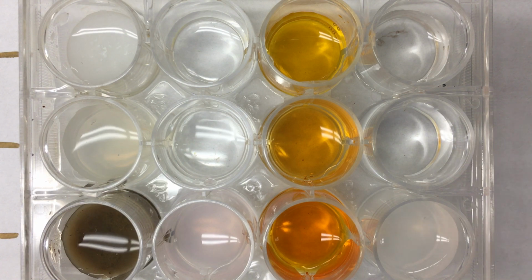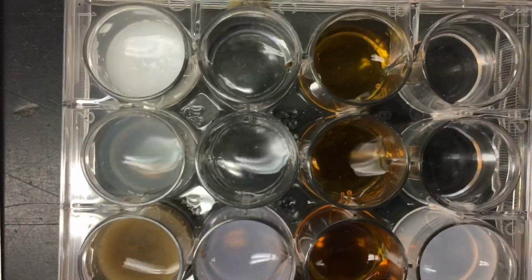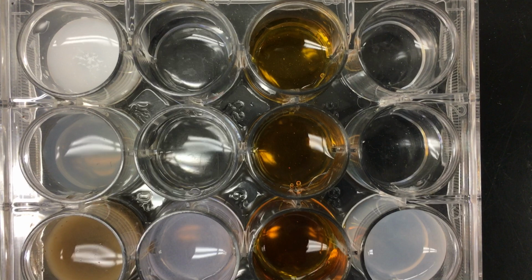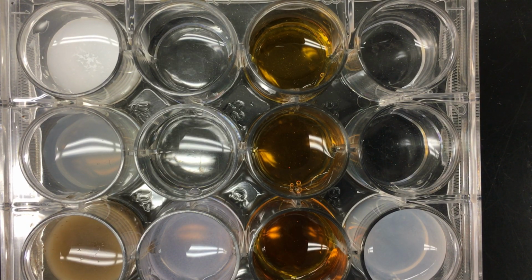Now against the black background, which is against the back of the lab table, I'll just slide this over here so we're against the lab table. Now you'll also be able to see if there's any kind of change that takes place. These are the exact same 12, and whenever it's against the white background, it's difficult to tell if the solutions that were clear and colorless have changed at all.